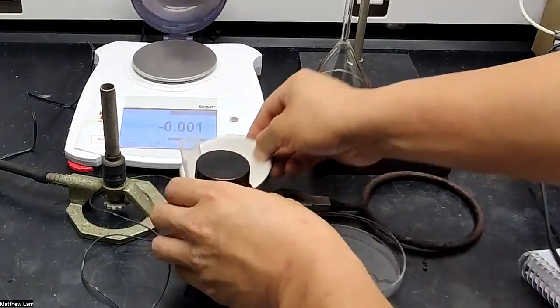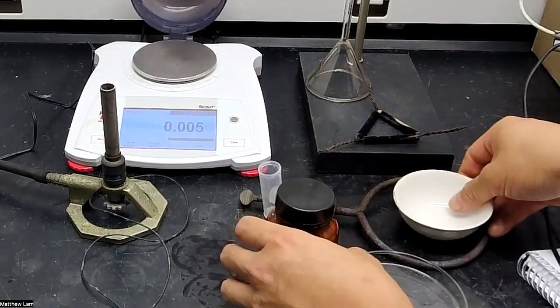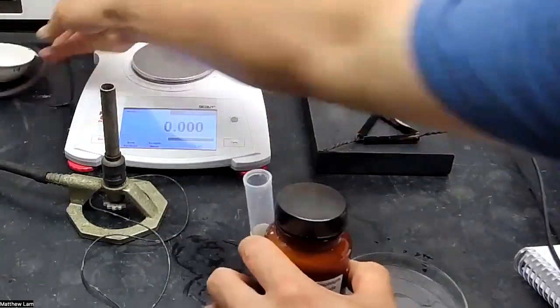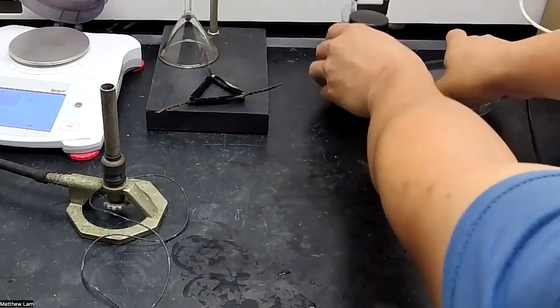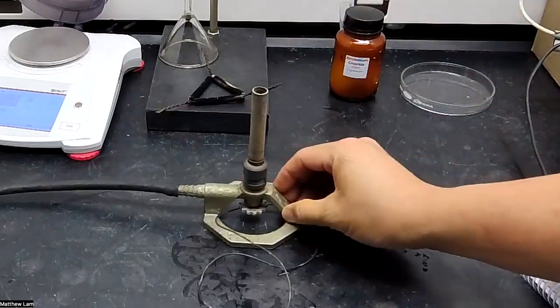But first, I want to show you how to use a Bunsen burner. So I'm going to quickly move these things out of the way and show you how to use a Bunsen burner.